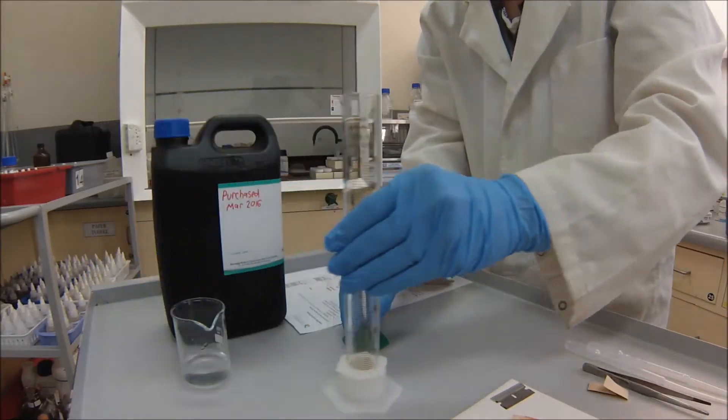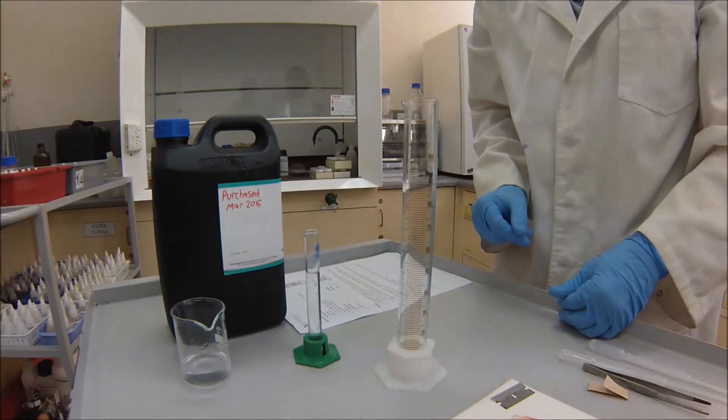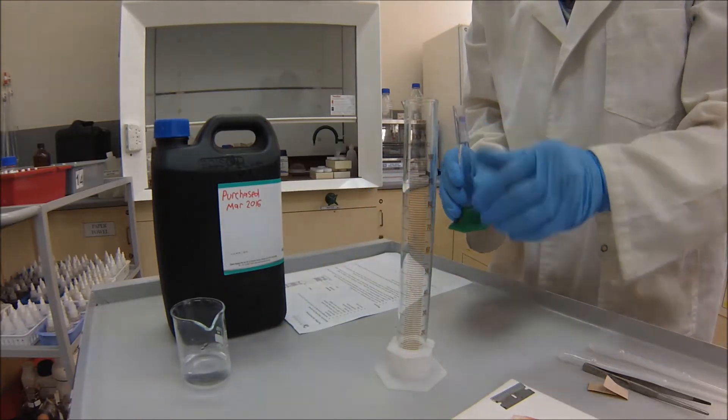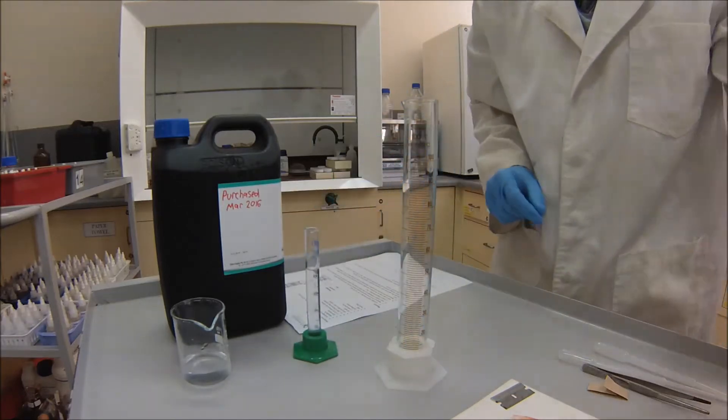And that's going to go into our 100ml measuring cylinder, which is what we're going to be using to measure the volume of gas produced in this reaction. So, one thing, almost forgot.